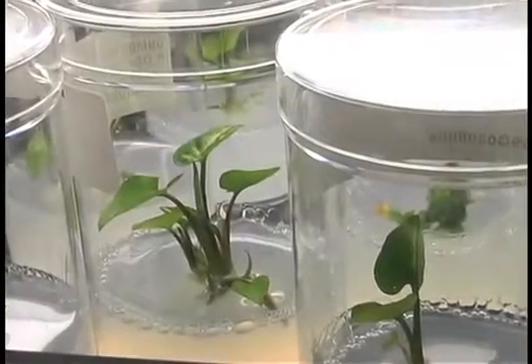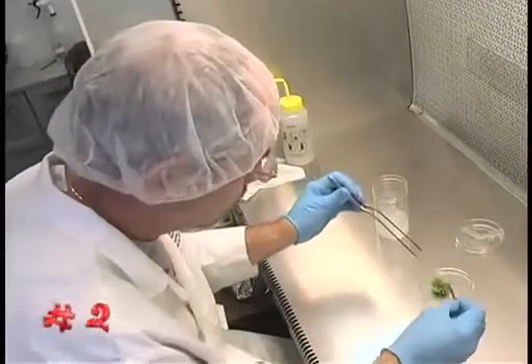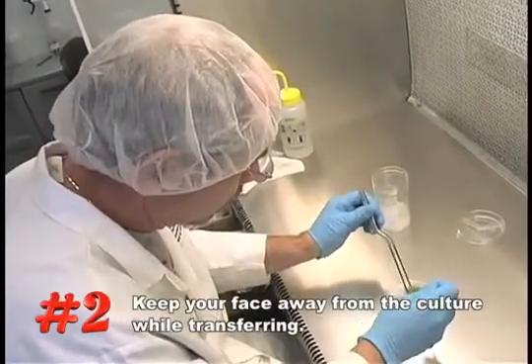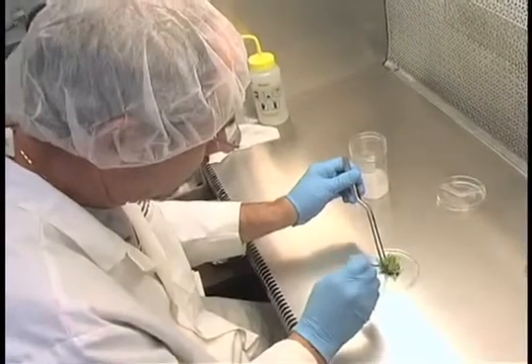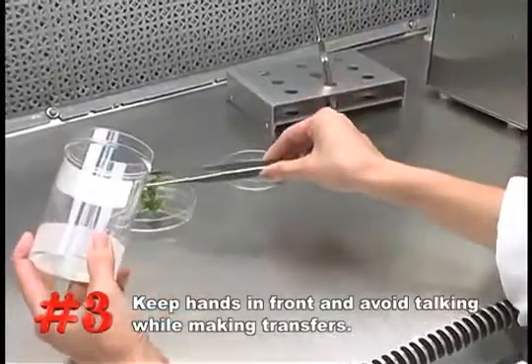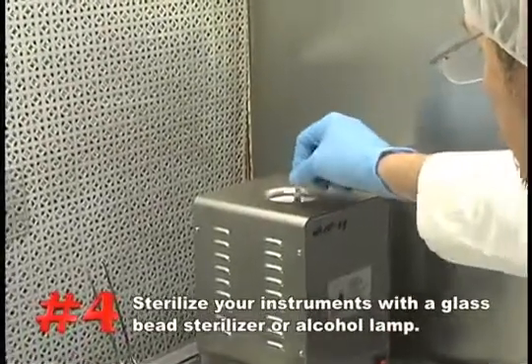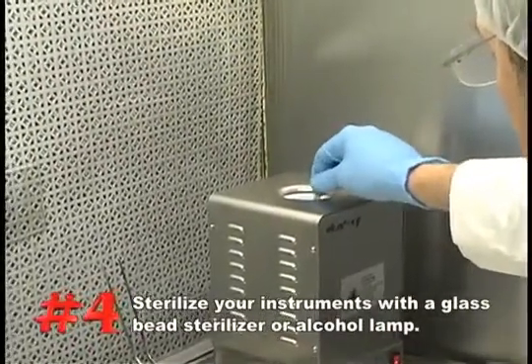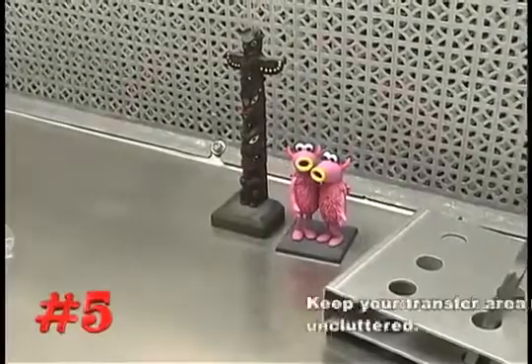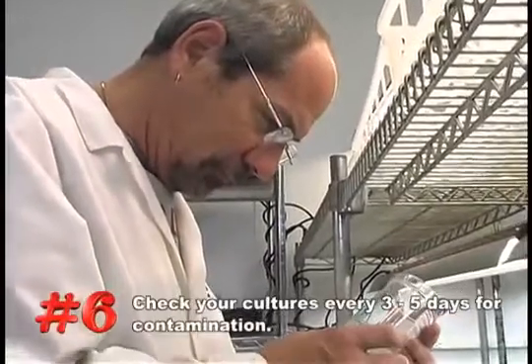To recap: 1. Always spray or wipe down the transfer area approximately 30 minutes prior to work. 2. Always keep your face and head away from the cultures you are transferring — remember that most contaminants are introduced through poor technique. 3. Work with your hands in front of you; avoid talking with others around you when making sterile transfers. 4. Use a glass bead sterilizer or alcohol lamp to flame your transfer instruments between transfers, and allow the instruments to cool between transfers. 5. Keep your transfer area clean and uncluttered. 6. Check your cultures every three to five days for contamination and discard all contaminated cultures to prevent cross-contamination.